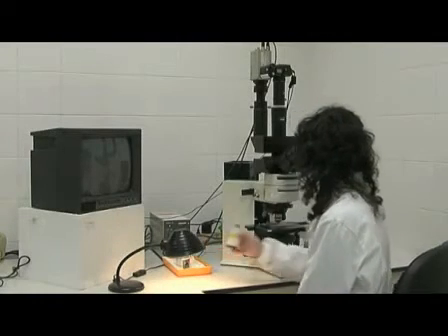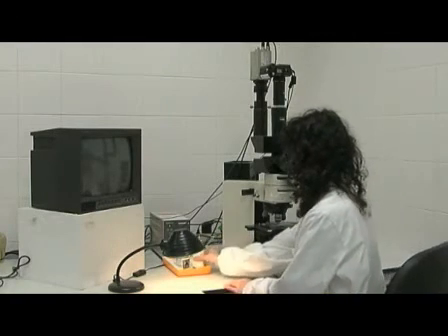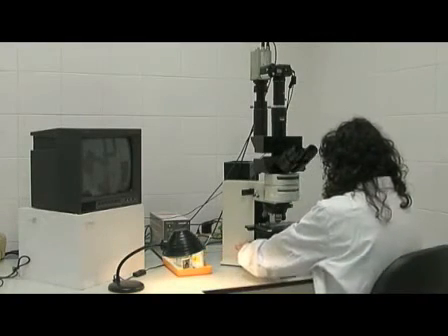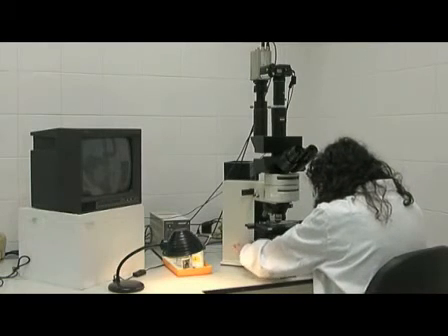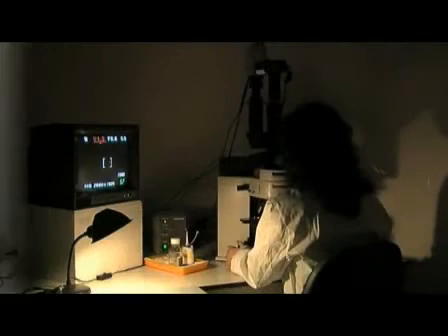The microscope that we are going to use for the visualization is an Olympus BX60 epifluorescent, equipped with a triple band filter for DAPI, Texas Red, FITC and single band filters for Aqua, FITC and Texas Red.